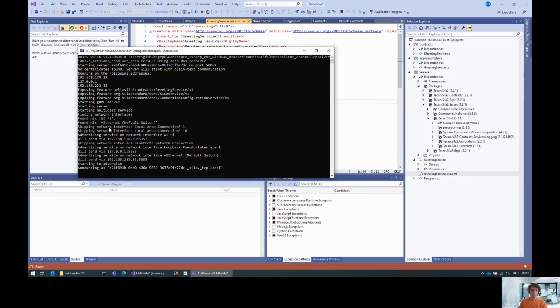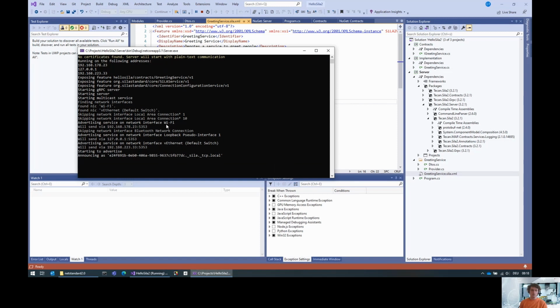And then we have some logs that the server has been started. It started a multicast service for discovery, and here we see on which network interfaces it's advertising the service using discovery. So on the Wi-Fi that I'm currently on, the loopback, and on this virtual Ethernet. On those network interfaces, the discovery is supported. And we have here a GUID that is used to announce the server.